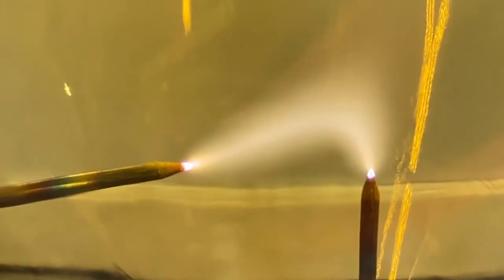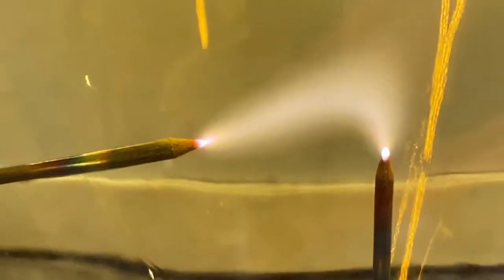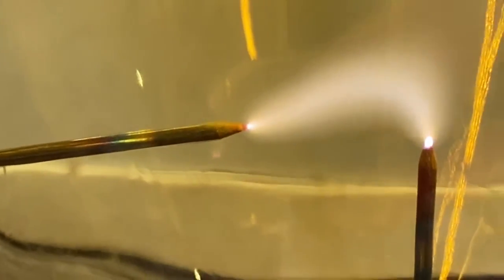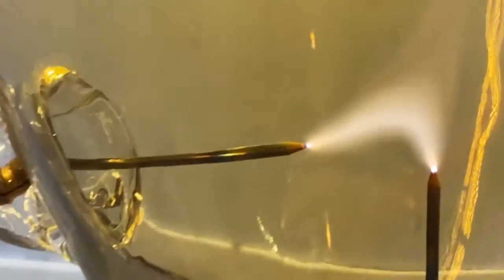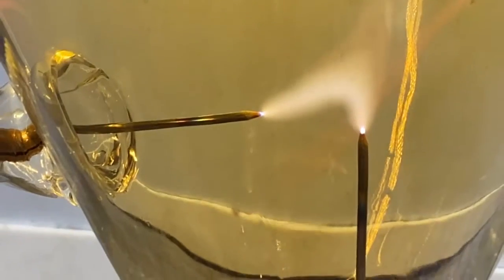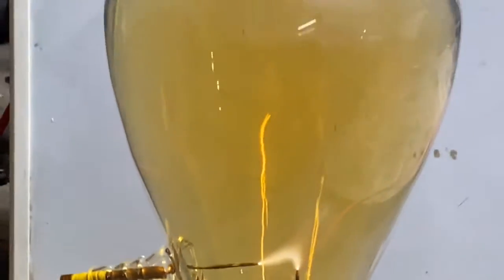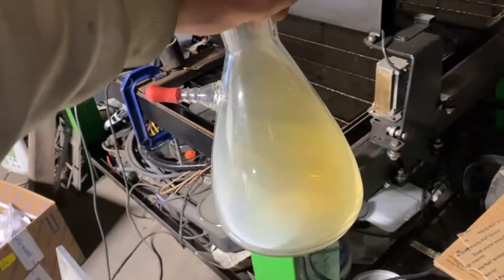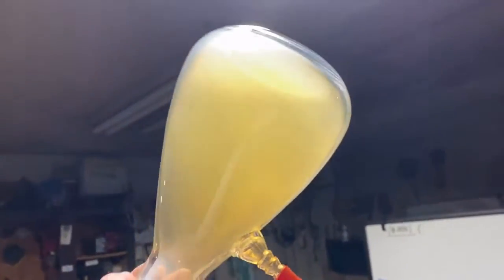This preliminary testing has brought to my attention an attribute of tungsten that I already knew of and just forgot about: you can't get tungsten over 800 degrees in oxygen or it turns into a beautiful yellow powder, and it's going to cover the whole glass in a yellow scaly muck.